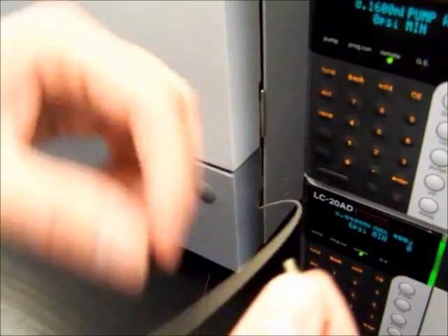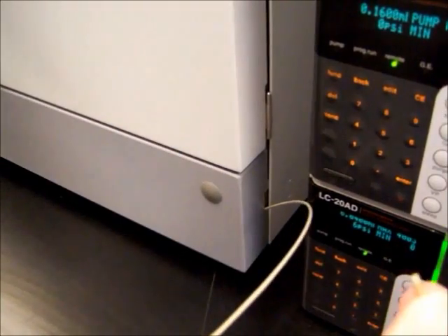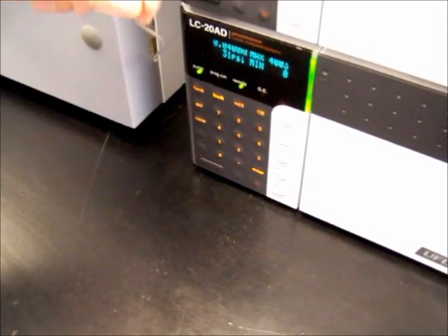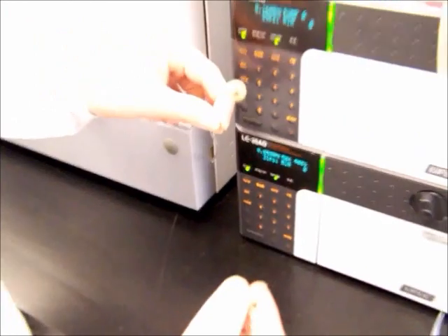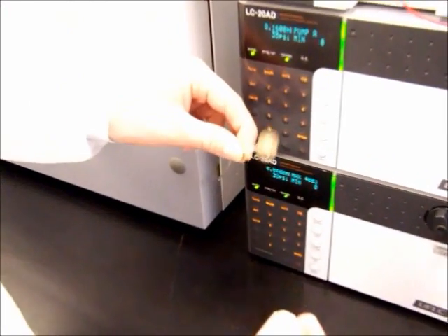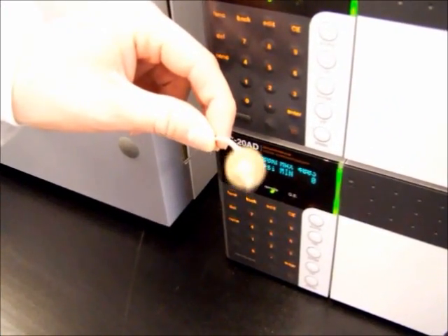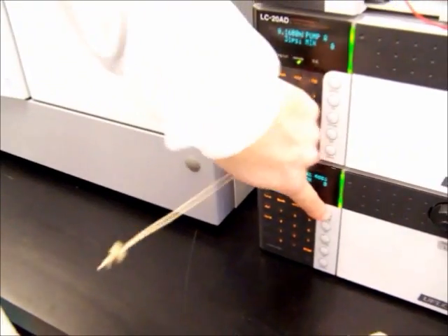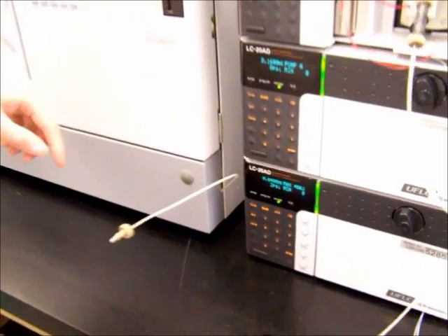Now, a good way to test, this is a good time to demonstrate it. A good time to test whether or not there's a clog in your line, or if you have a crimped tube during cutting, is to turn on the pumps. You'll notice a little bit of fluid coming through right there. If a little bit of fluid is coming through, you know that your line is clear and that your hose isn't crimped at any point. So, we're going to shut that off now. I'm pushing the pump off button. I'm pushing the pump button again.